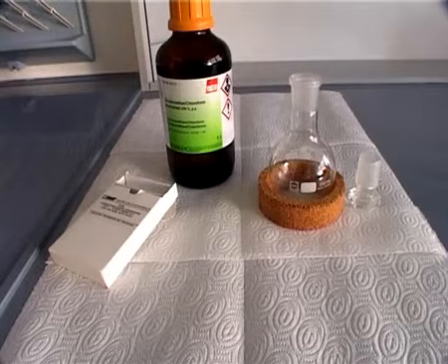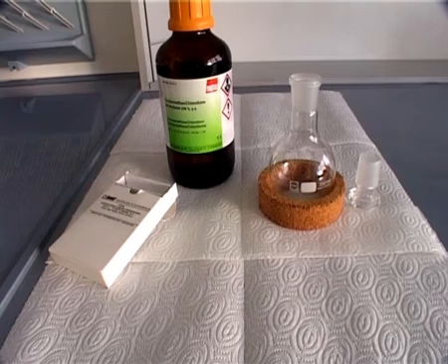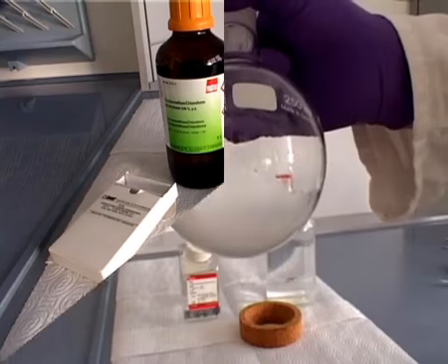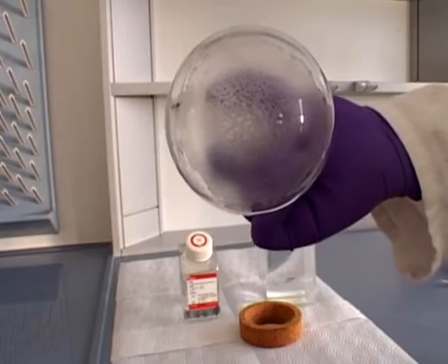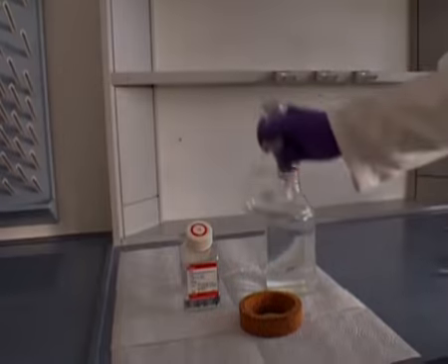For lipid preparation, one needs the lipids POPC and nickel DOGS, chloroform and a clean round bottom flask. Dissolve the lipids in the desired ratio in chloroform and dry them under vacuum. As shown here, after high vacuum treatment overnight, the lipids form a film on the inside of the flask.